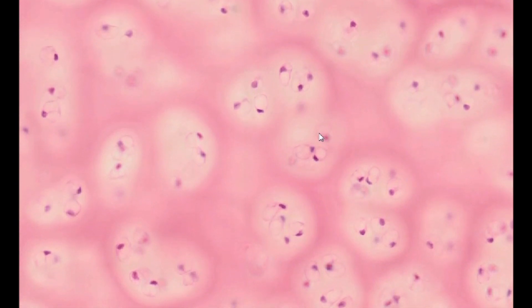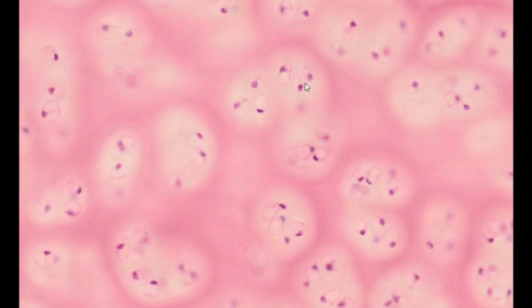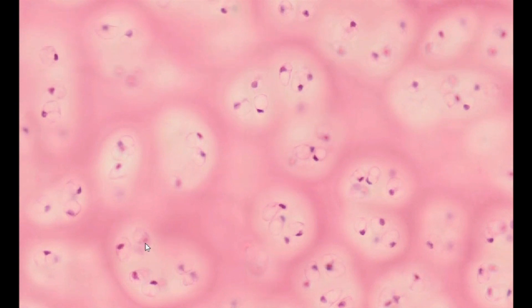Chondrocyte nuclei are small, with diffuse chromatin, often shifted to the edge of the cell, with one or two nucleoli.